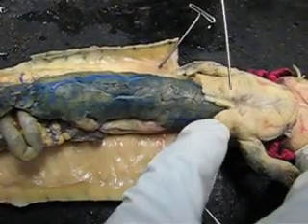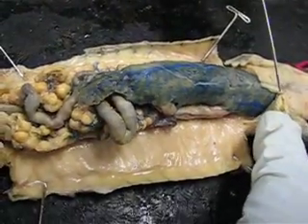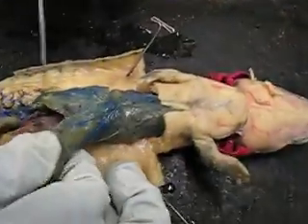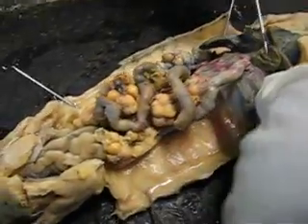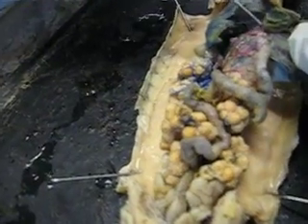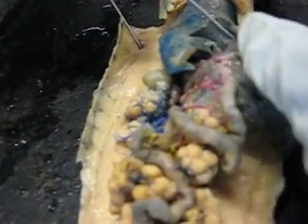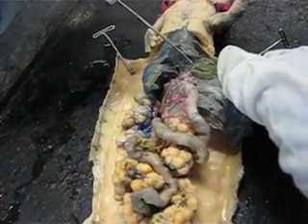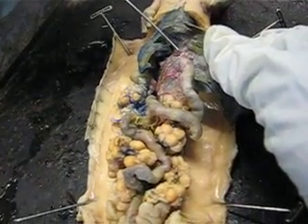Here's the liver. The falciform ligament is going to connect the liver to the rest of the body. Underneath the liver we're going to have the gallbladder, which is this green structure right here. The cystic duct is going to drain the gallbladder. The hepatic duct is going to be draining the liver — there's going to be two on either side, and they're going to join into the common bile duct, which is going to be near the duodenum.